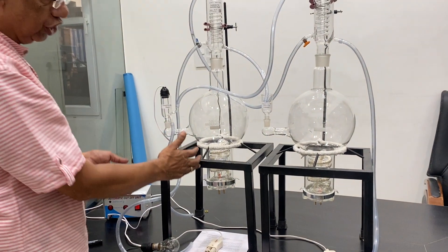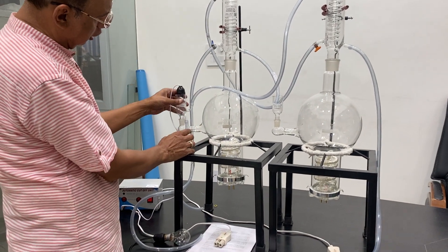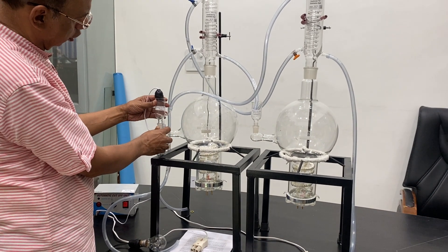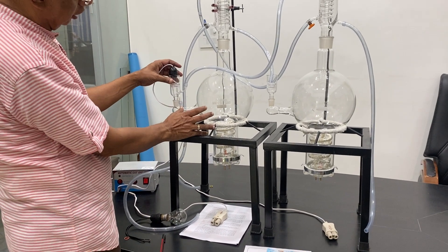Let me show you. When this reaches you, it will come in boxes like this and then you can take out from these boxes and put — first of all you have to put the flask. This flask and this funnel is marked as funnel for hot water. This is for one, this is for automatic. There is a probe — if the water is filled up to this section, then only it starts the heaters.